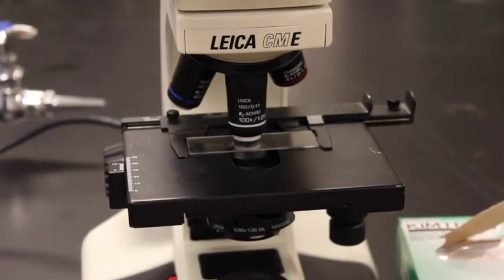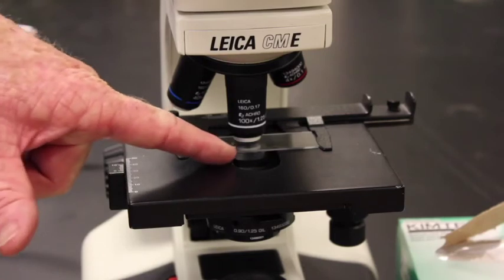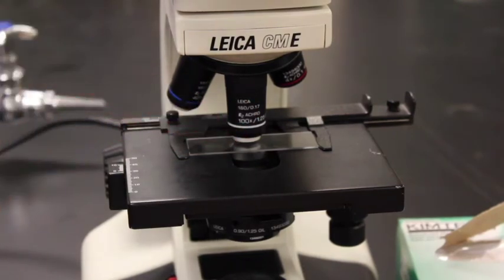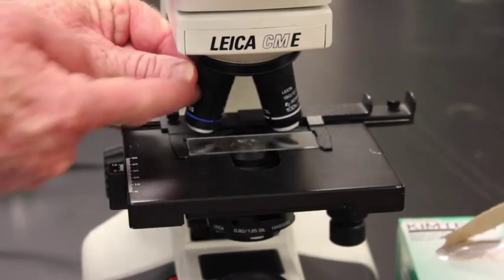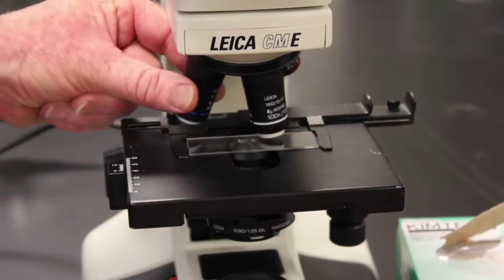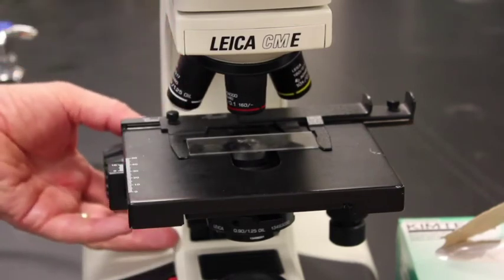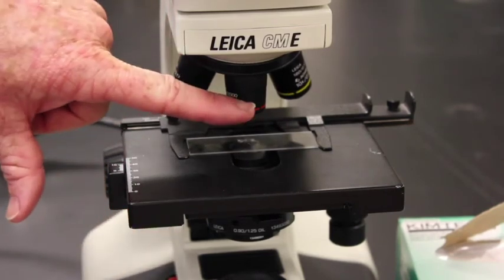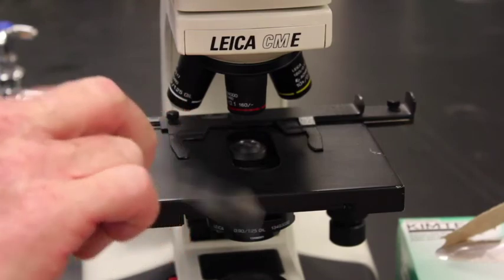The technique we'll be working on right now is just simply how to put away your microscope. So here we have a microscope, it's in focus, we've got a slide on here, oil immersion objective is in place, and it has oil on it. So now I want to put it away properly. And so the key thing is if there's oil on this slide right here, I can't swivel back to the 40x because this 40x is going to go right in the oil. So I have to swivel my scope this way. You notice I did not change the focus. I just swiveled the 4x in place. That gives me room for the stage to where I can go in and I can remove the slide.